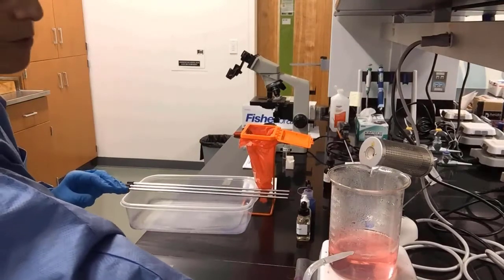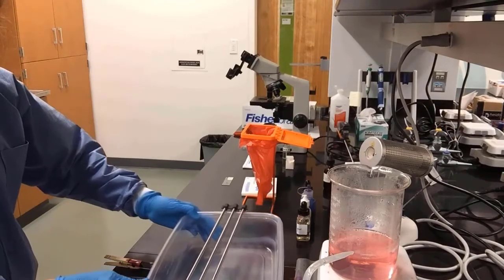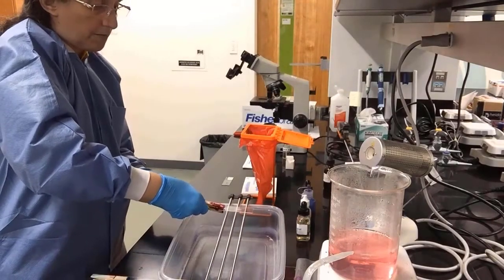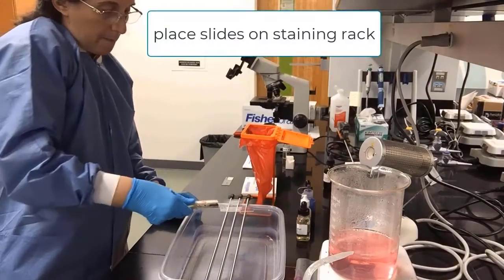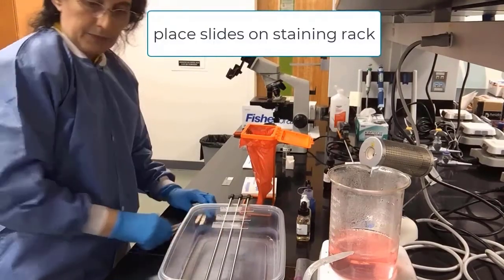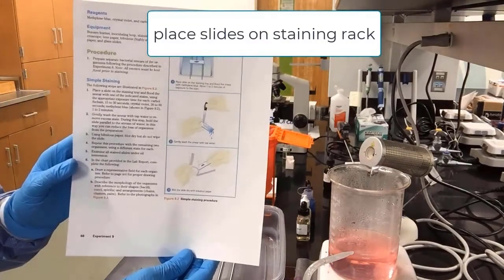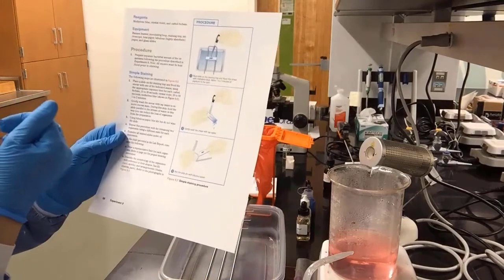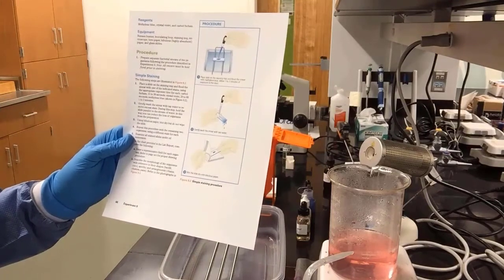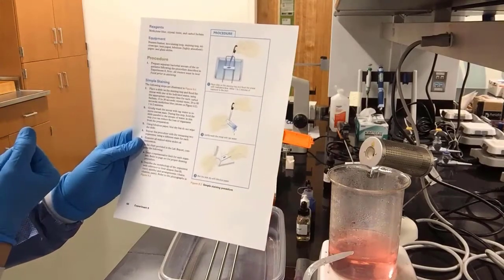and now we will move into view our nice staining rack. We place the slides and unclip them onto the staining rack. And now we are ready to begin our staining procedure. Your book has the protocol for this simple staining procedure. You will notice we stain for about 2 minutes and then we wash with water and blot dry our slides and put them under the microscope.